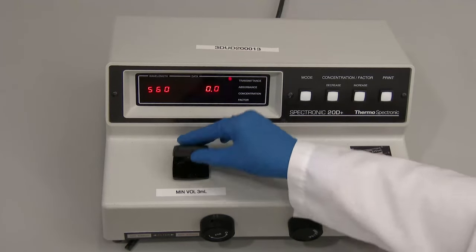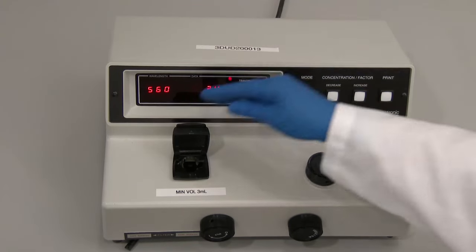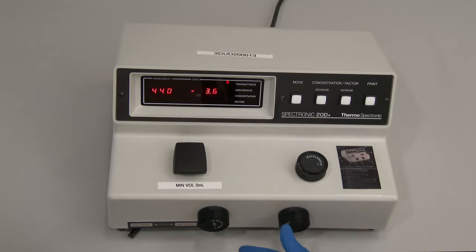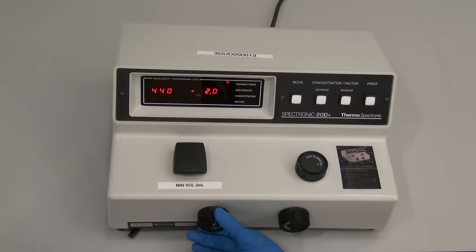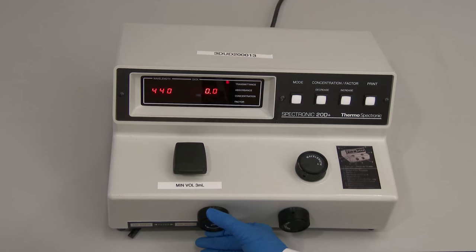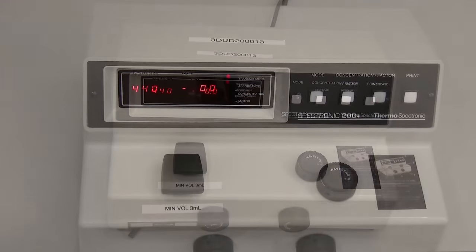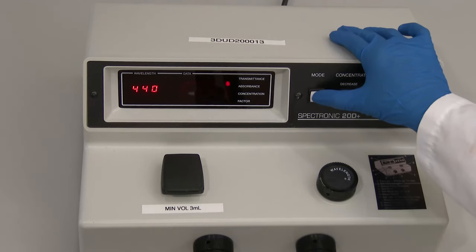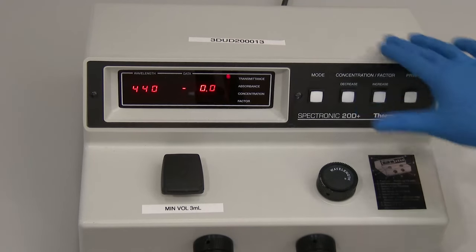To account for any stray light in the sample compartment that could affect measurements, the instrument is first blanked or zeroed with nothing in the sample compartment. To zero the spectrophotometer, ensure that the sample compartment is empty and the cover is closed. Turn the power switch zero control knob percentage T until the digital display shows the transmittance as zero percent. Note that this may require several turns of the knob. Refer to your procedure to identify the desired measurement and use the mode selection button to toggle to the appropriate setting.